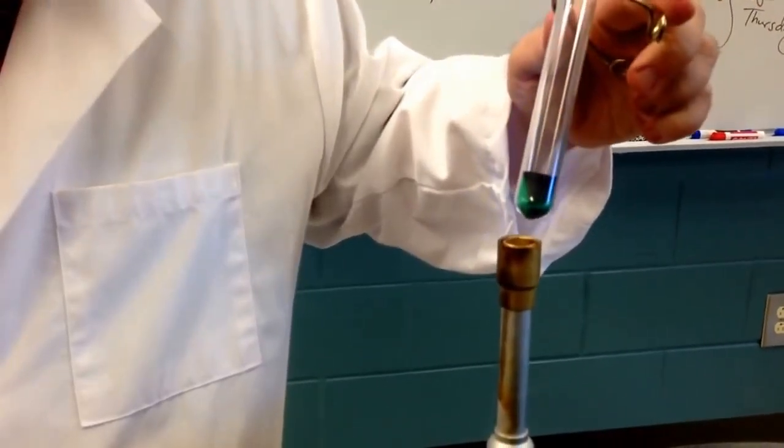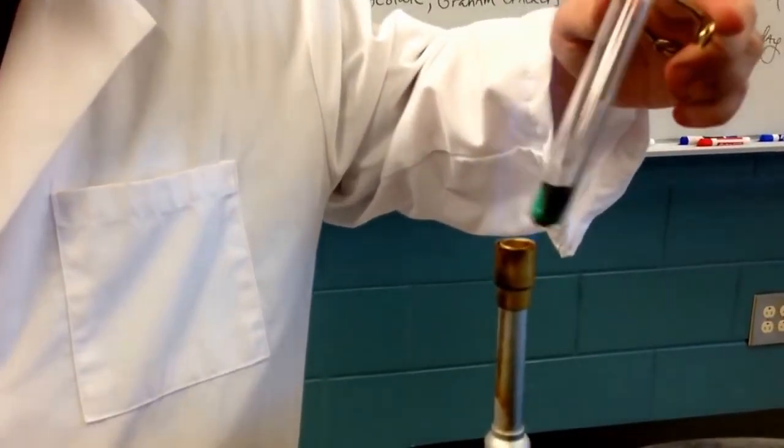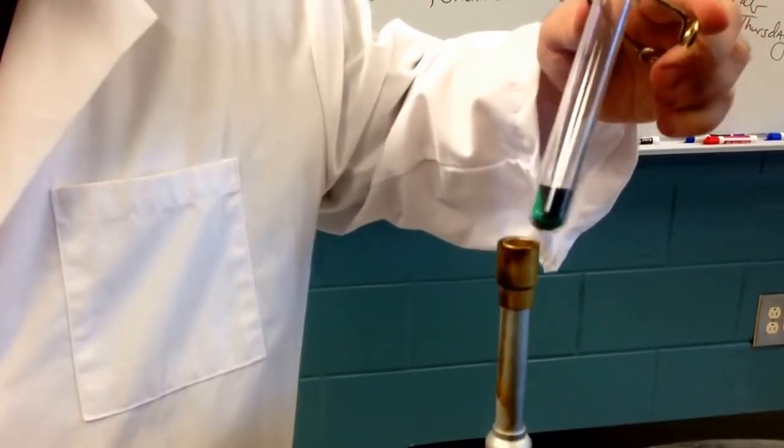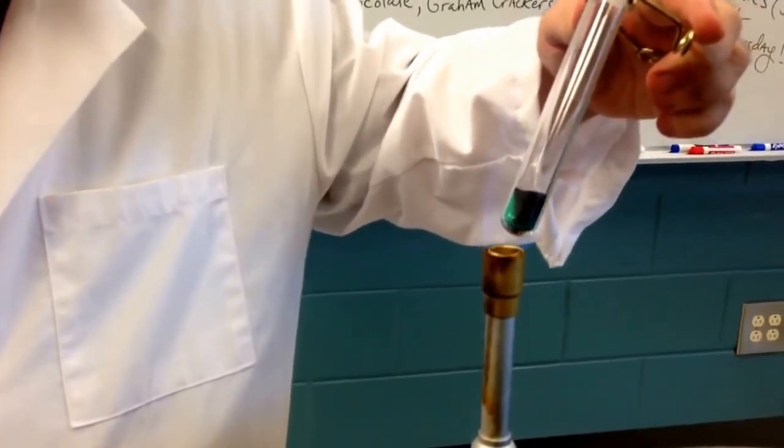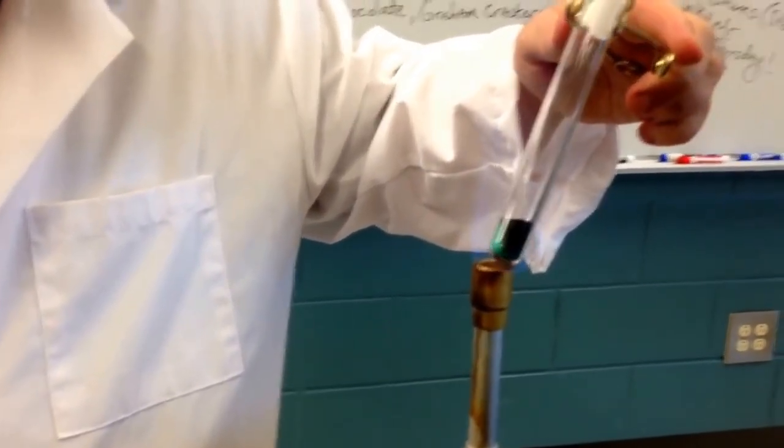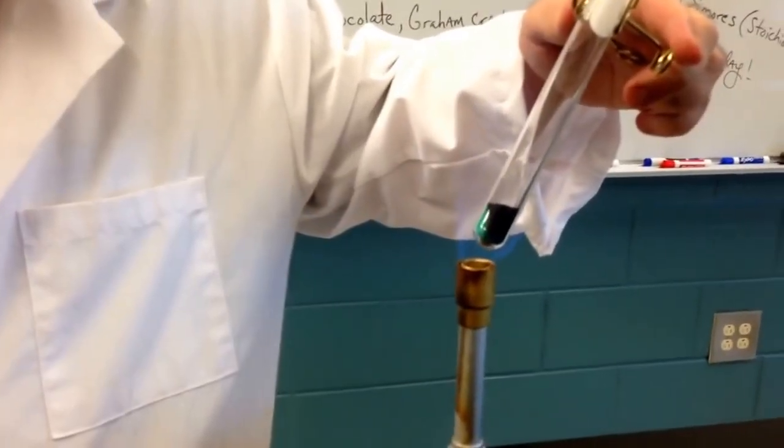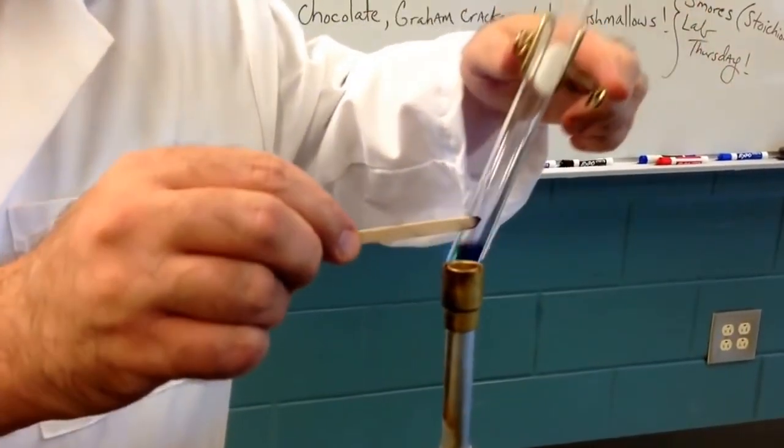All right, it's starting to bubble a little bit. Give it just a little bit more time. Light your splint.